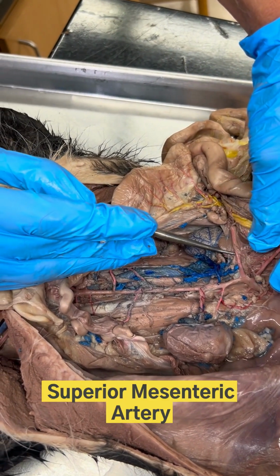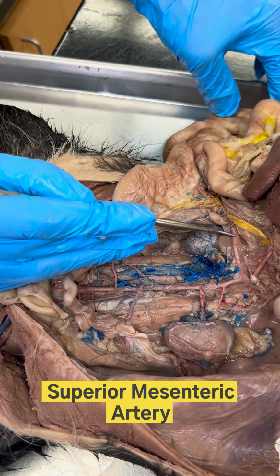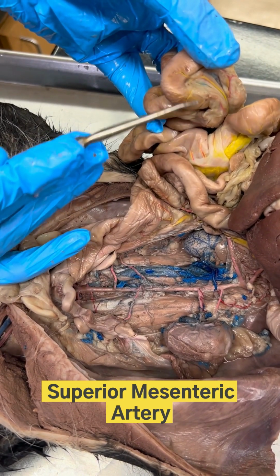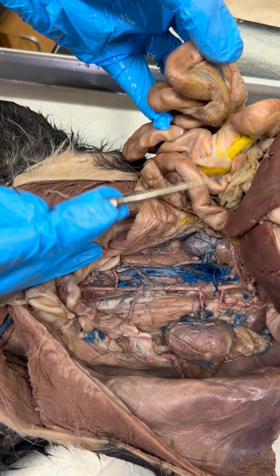The next artery branch to come off the abdominal aorta right here is the superior mesenteric artery. And if I show you what organ that vessel is attaching to, you'll see that it's the small intestine. That makes sense, as the superior mesenteric artery supplies blood to the small intestine.